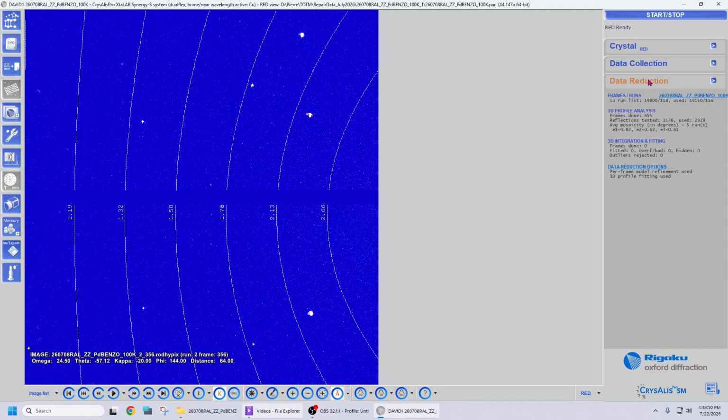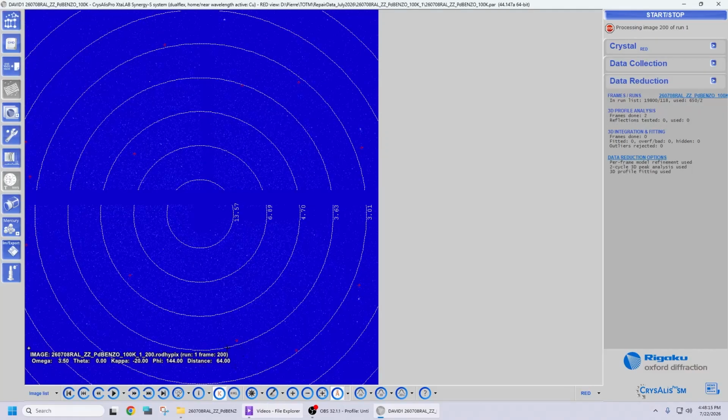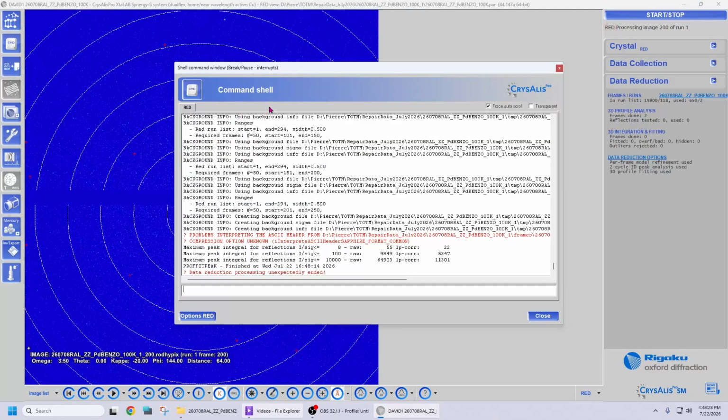In the same vein, if I try to process a dataset, CrysAlisᴾʳᵒ will go just fine through the first 200 images and then stop at image 201. At the top right corner of the CrysAlisᴾʳᵒ interface, there's a red light that is flashing. If I click on it, I can open the command shell, which itself displays a view of the data reduction log file. And that log file shows the same error message as previously, meaning that CrysAlisᴾʳᵒ encountered a problem when reading the header of image file number 201 of the first scan.